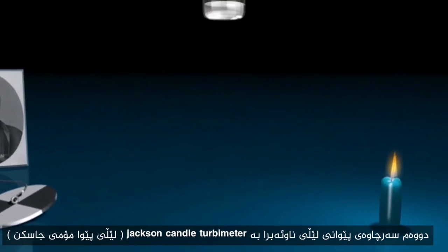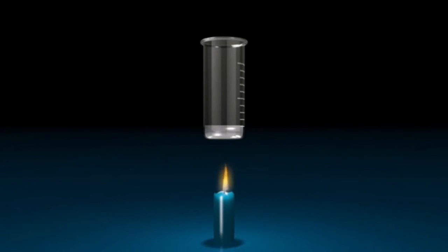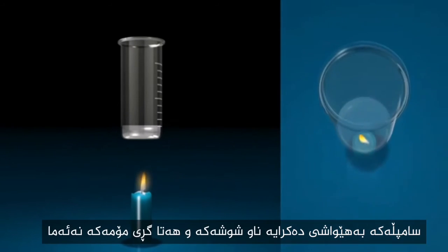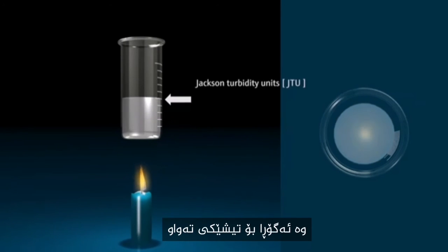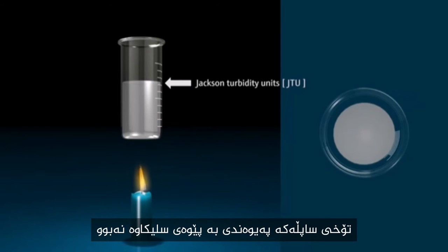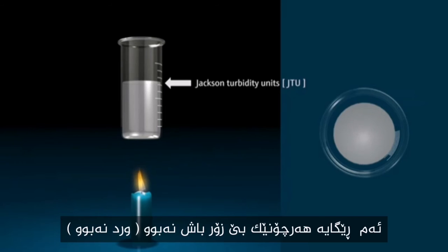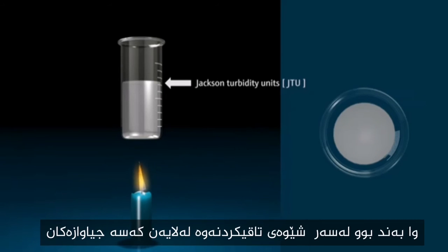The second turbidity reference was the so-called Jackson candle turbidimeter. It is comprised of a special candle and a glass vessel. A sample is slowly poured into the vessel until the candle flame is completely obscured and changes into an even shine. The sample depth is then related to the silica scale and the turbidity is measured in Jackson turbidity units. These methods are, however, not precise and depend on the subjective impression of the testing person.